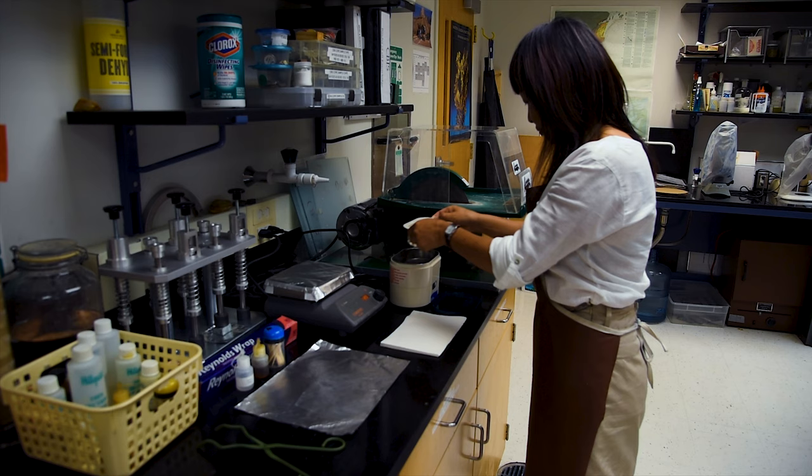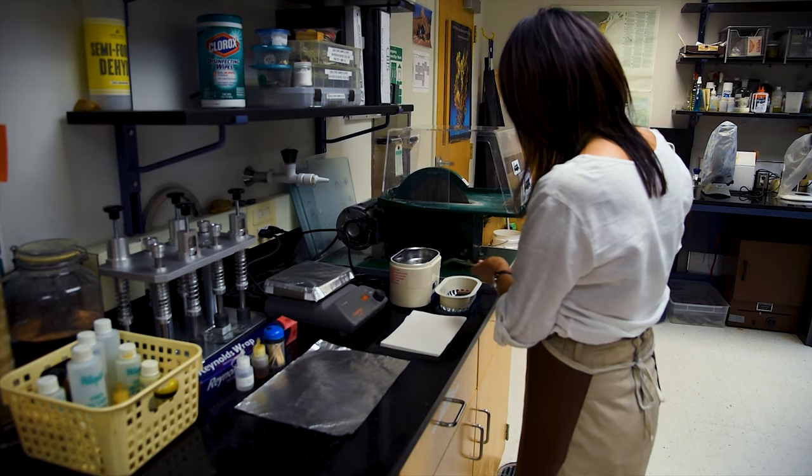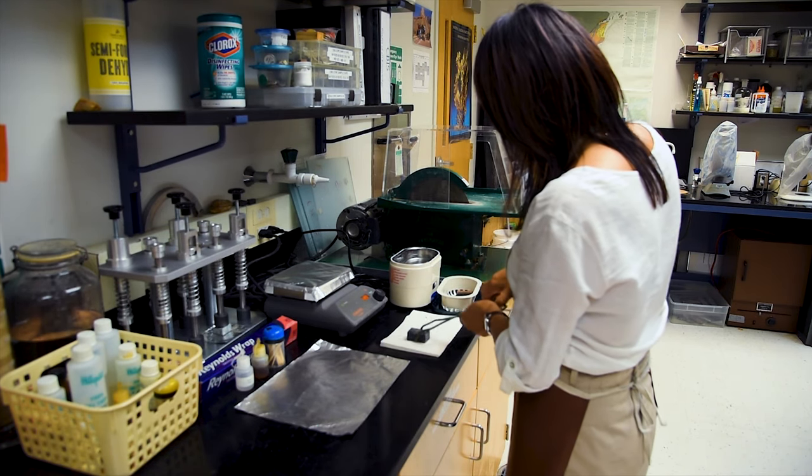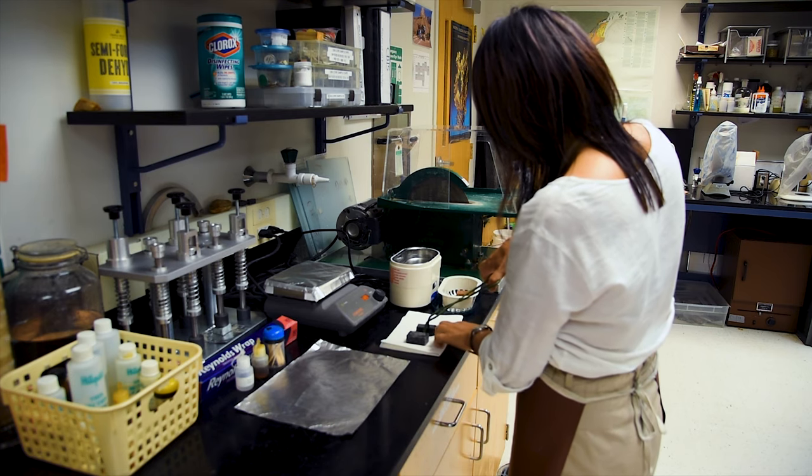Once the chips have finished in the ultrasonic cleaner, they can be removed and placed on a clean paper towel to absorb the excess water. Care should be taken not to re-contaminate the polished surface by touching it or setting it down on dusty or gritty surfaces.